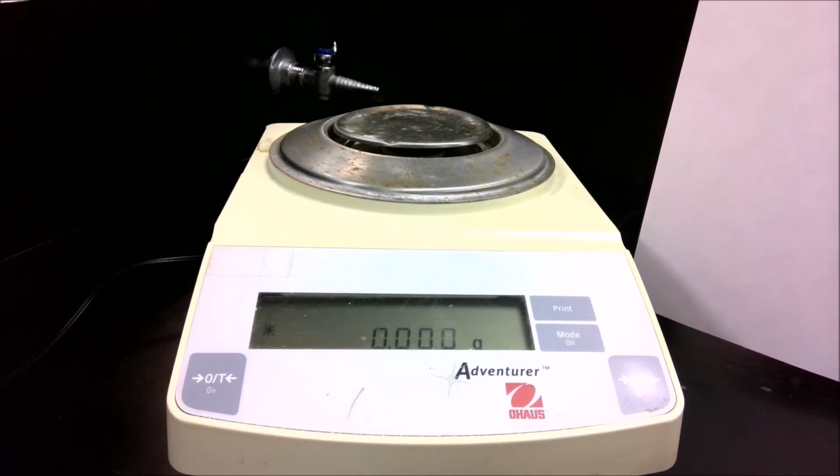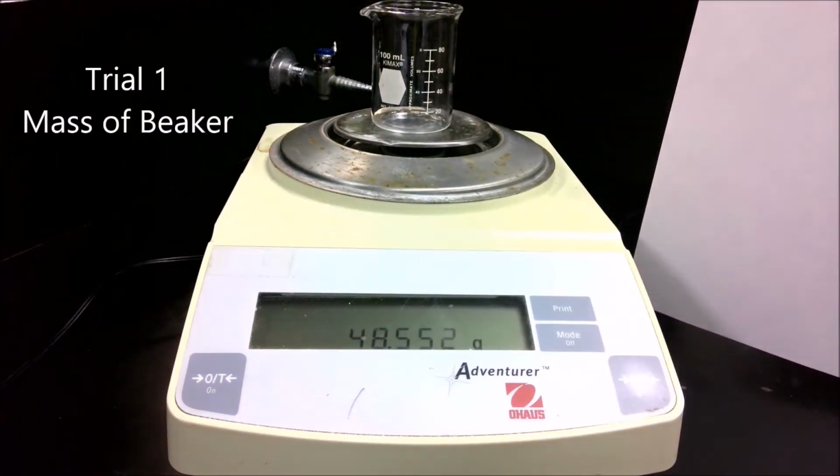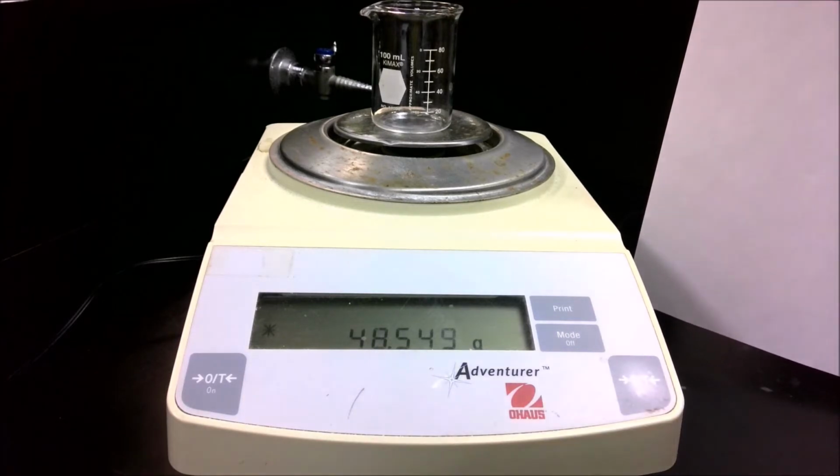To get the mass, I first start by taking a clean, dry beaker, and I measure its mass. So record that as the mass of your beaker. Then, using my pipette, I'm going to get 5 milliliters of water, and I'm going to carefully add it to the beaker.